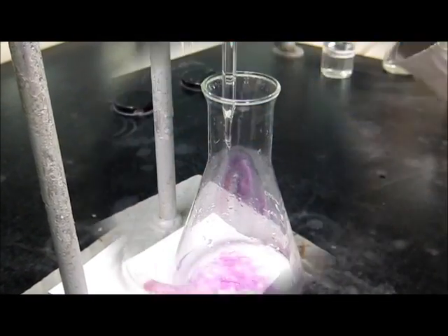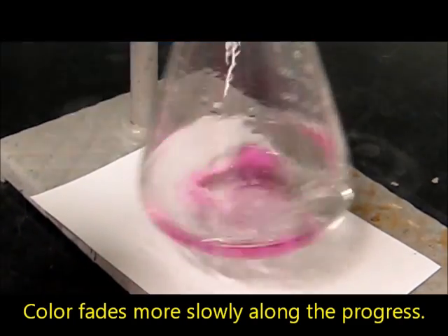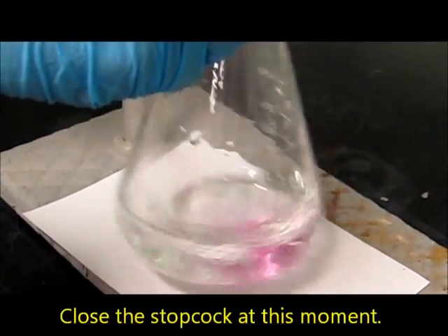But this is a deception, so the colour will fade more slowly along the progress. You have to be patient. At this moment of time, close the stopcock.